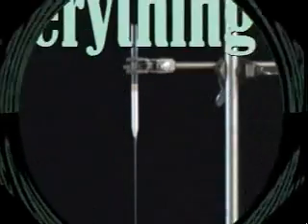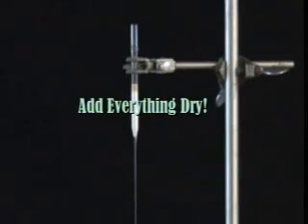When you need to purify a small amount of compound, it is sometimes easier to run a microcolumn in a pipette. On small scale, the packing and sample loading steps are greatly simplified. It is easiest to pack a microcolumn completely dry, without any solvent.